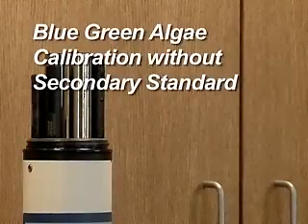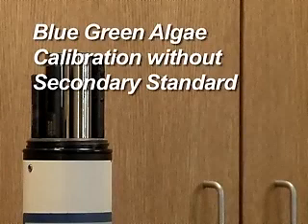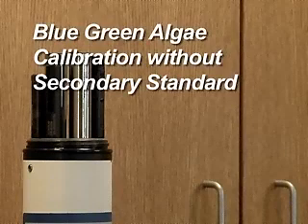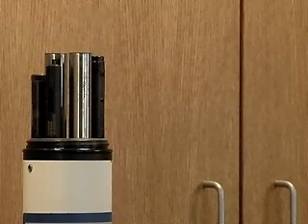Blue-green algae calibration without secondary standard. The blue-green algae fluorometers use the same principles but different wavelengths of light to detect different chemicals in the sample.